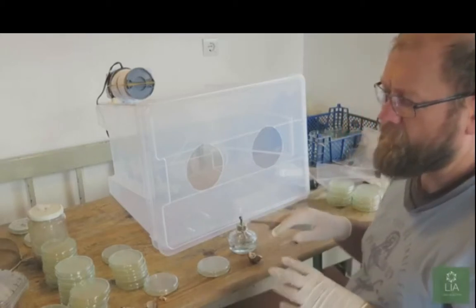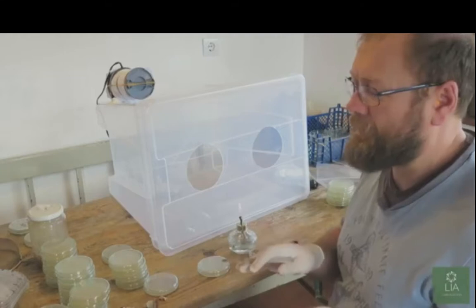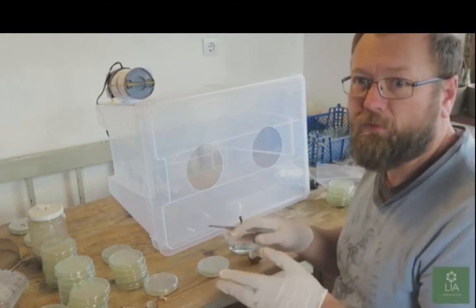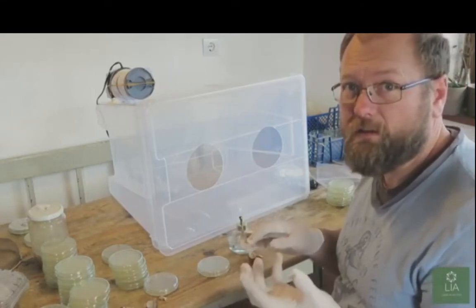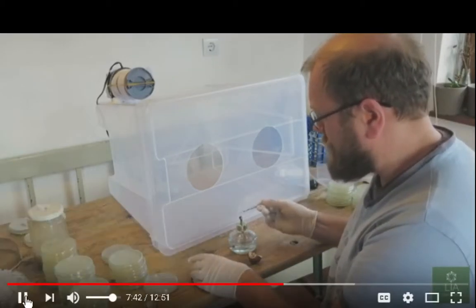Whenever you're transferring mycelium material, there's always going to be a chance that you're going to get contamination. So you may have to repeat this process 2 or 3 times before you get a clean mycelium. So first of all, you're going to sterilize your... Right, so what he means by that is, you get the mycelium in the first dish, it's got a bunch of stuff in there, plus the mycelium that you want, and then you take that mycelium out, transfer it into another dish. It's sort of like a way of filtering out the contaminants. So I know all about that.